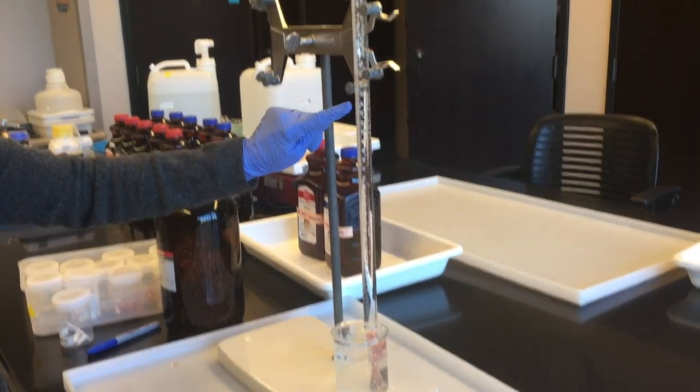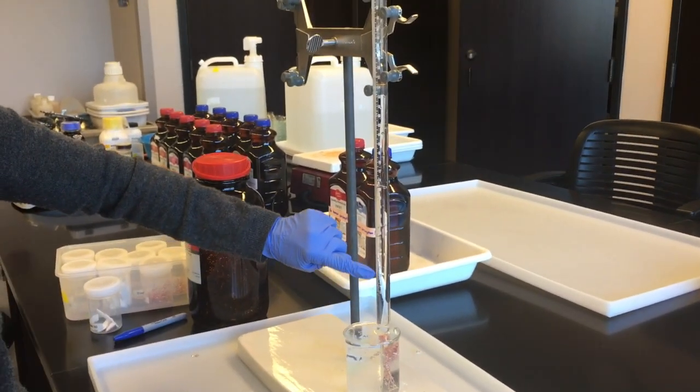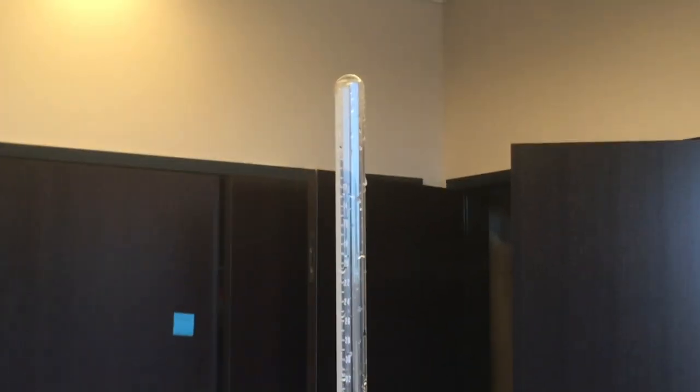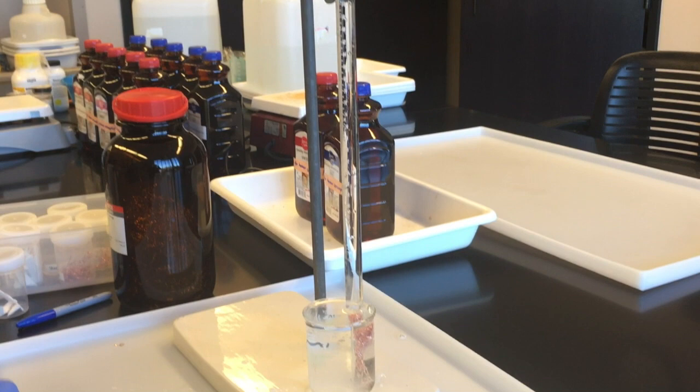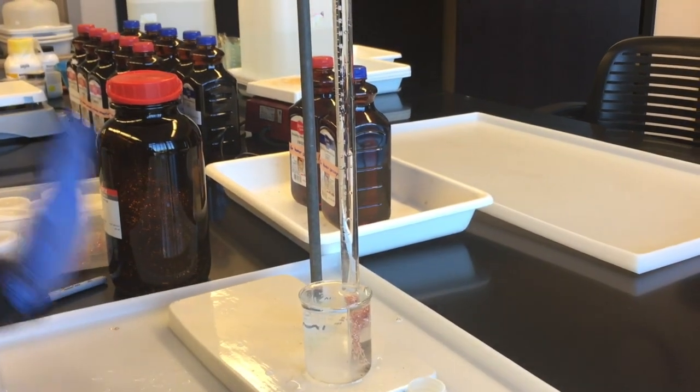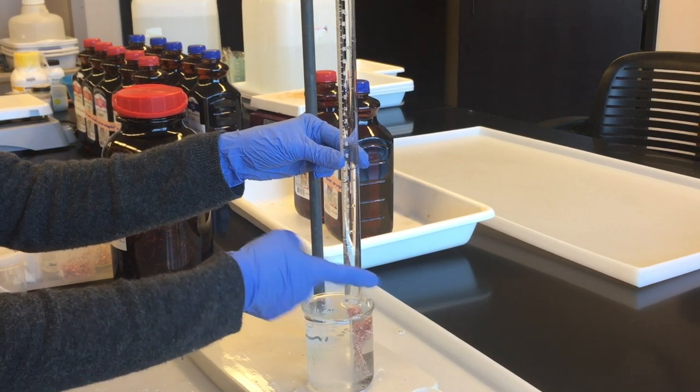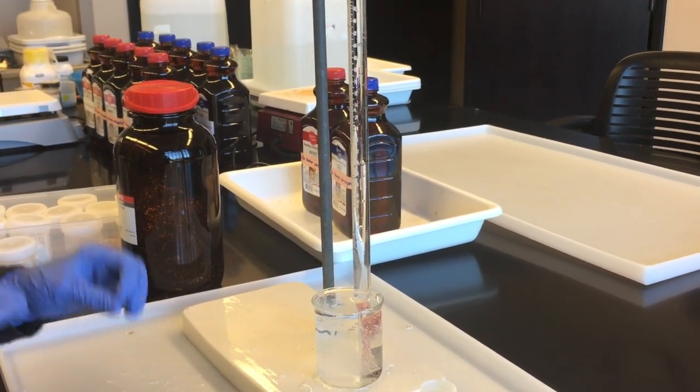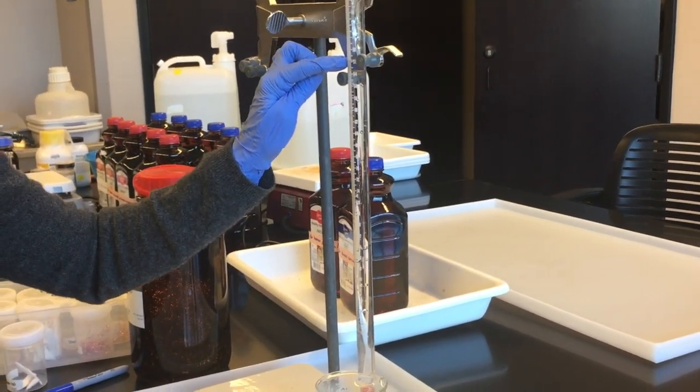So this one has a nice vigorous reaction and hydrogen gas was being produced and it came up and it's filling the gas measuring tube and it pushed the water down. And so I'm going to show you how you, once the reaction is completely done, when you don't observe any more bubbles being produced and you've tapped and tapped and tapped, then I'm going to show you how you level the water in the leveling tank.